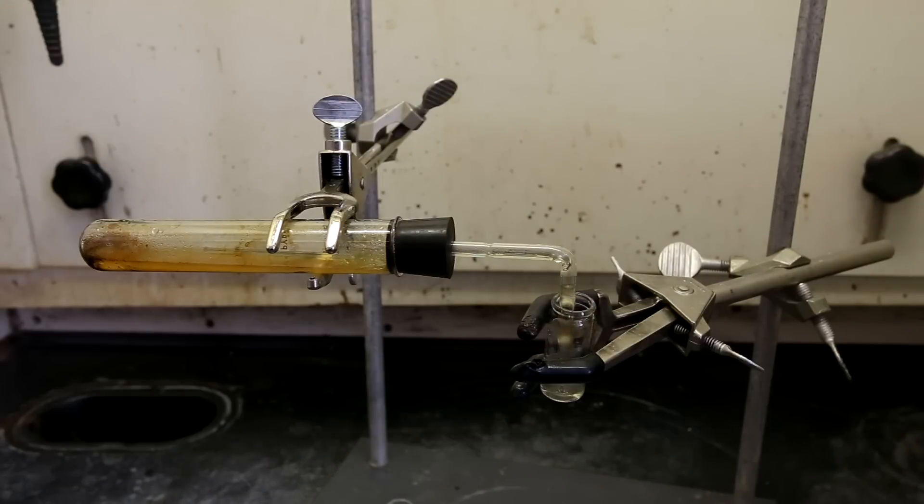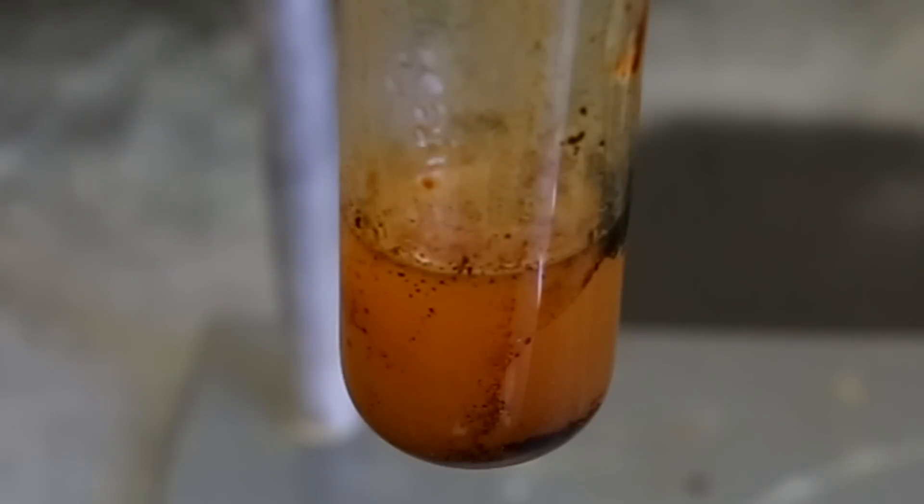Unfortunately I didn't catch the suck back on film, but this is what it looks like after it pulled all of the liquid out of the dram vial. This is what the water-cadaverine solution looks like at the bottom of the test tube.